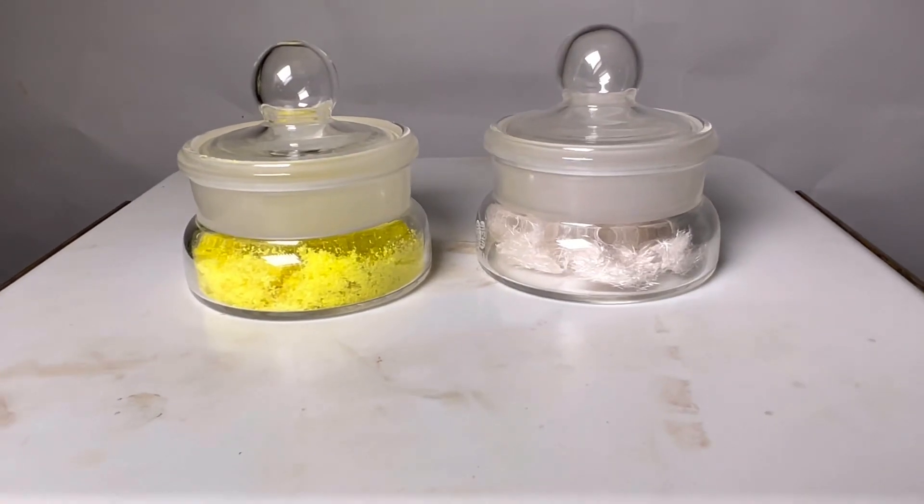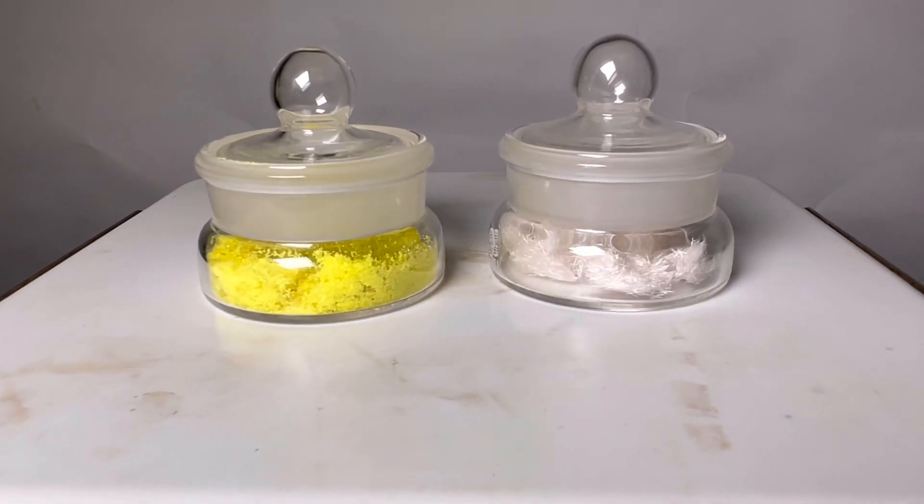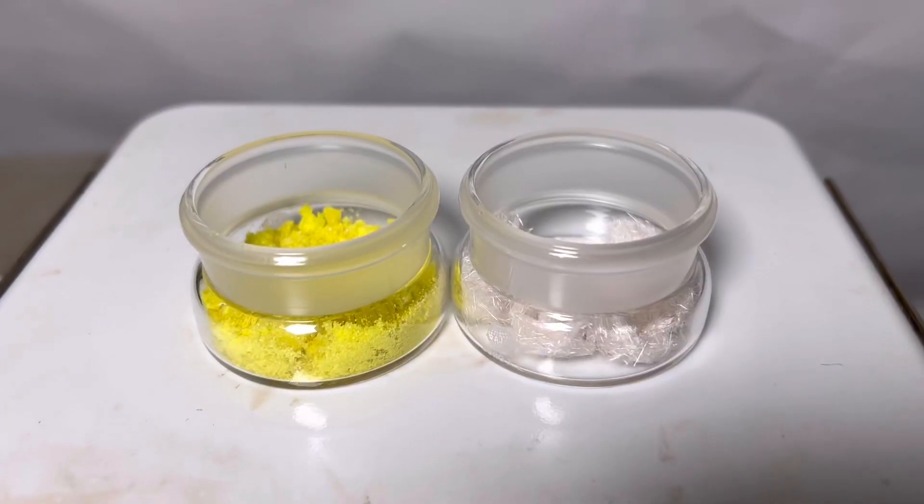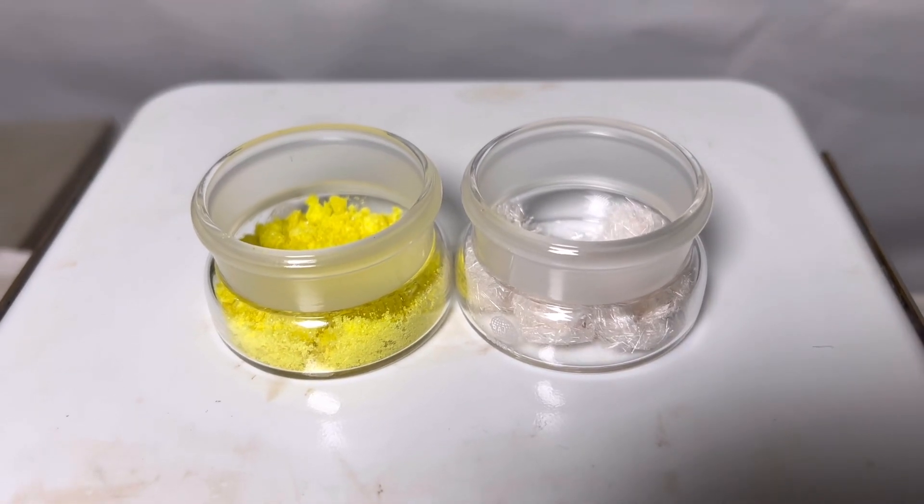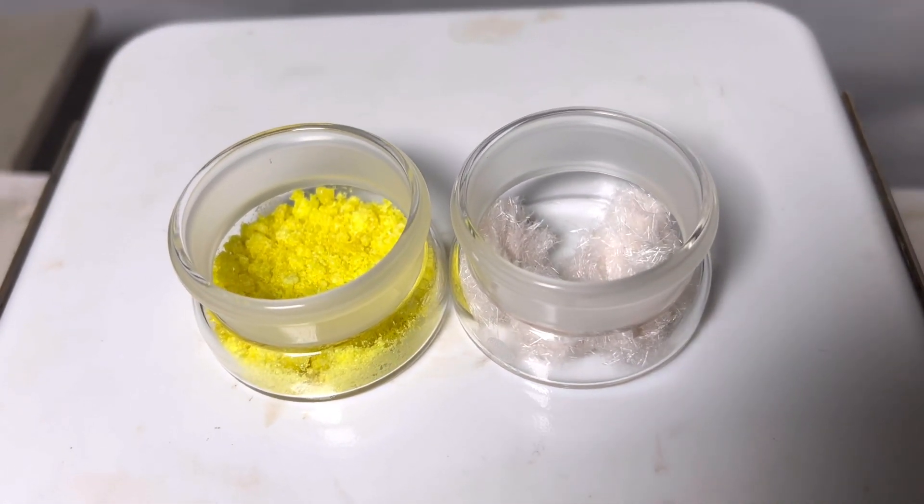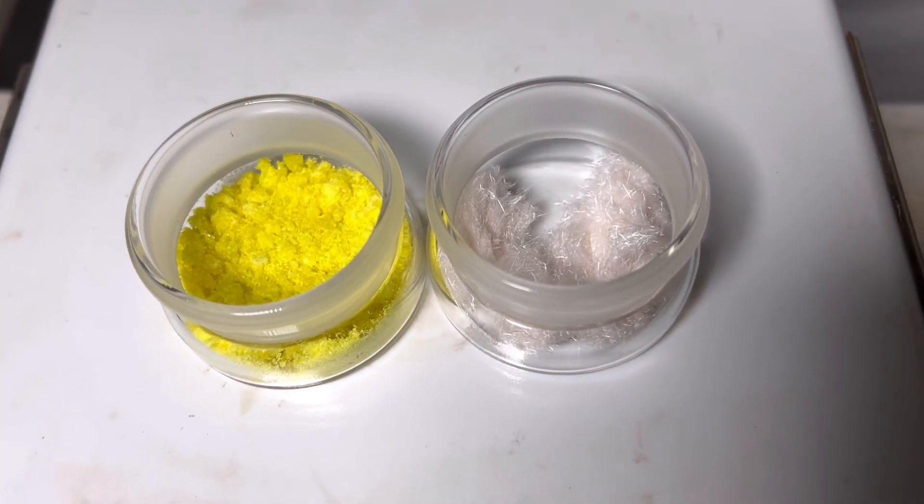Here we have the ortho and the para-nitrophenol side by side. Both the products are of very good quality. The final yield of ortho-nitrophenol was approximately 10 grams. The para-nitrophenol was approximately 2 grams.